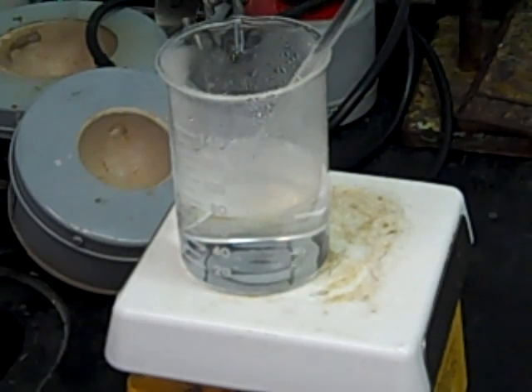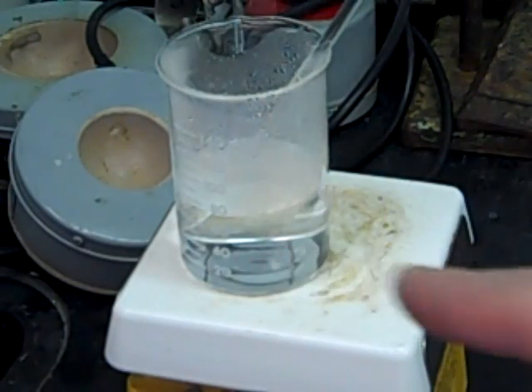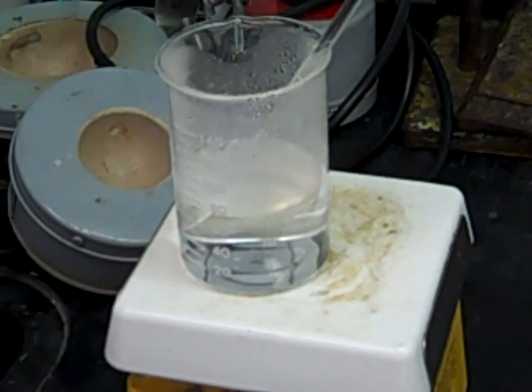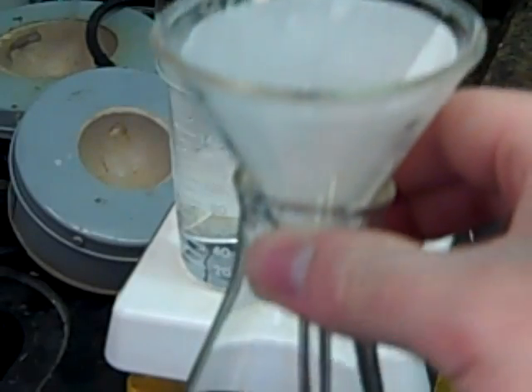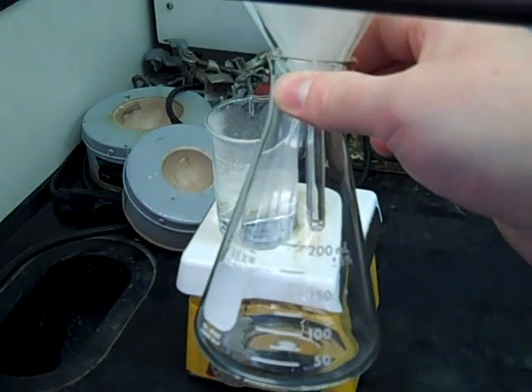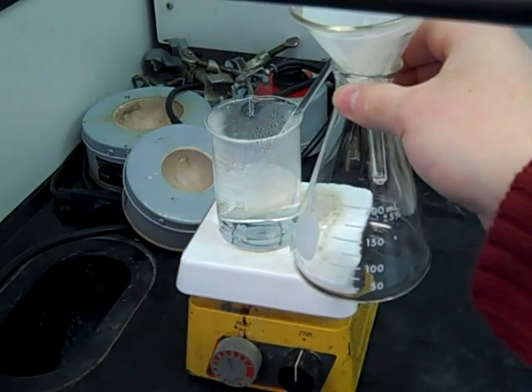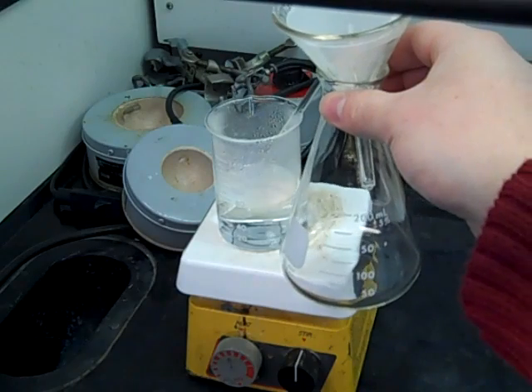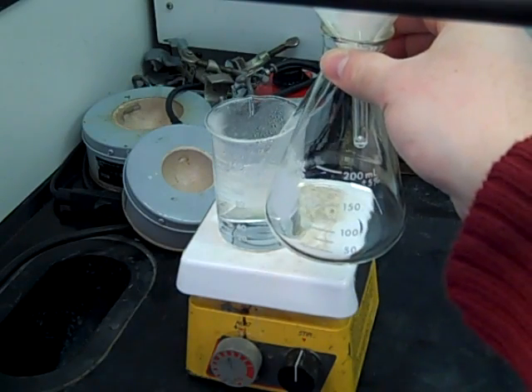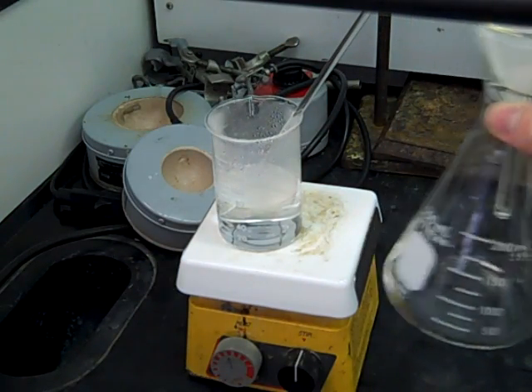However, if you've tried to heat this and added more solvent and there are still little solids at the bottom, it's very possible that you've got some insoluble impurities in your solid. If you do happen to have impurities, you can take a gravity filtration apparatus — a funnel with a filter paper on top of a normal flask. You could put this on top of the hot plate, let the whole apparatus heat up, and then do a hot filtration of your solution to get rid of those insoluble impurities. In this case, you won't need to use this.